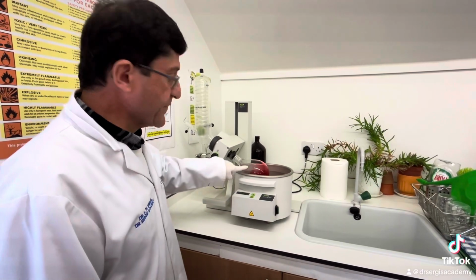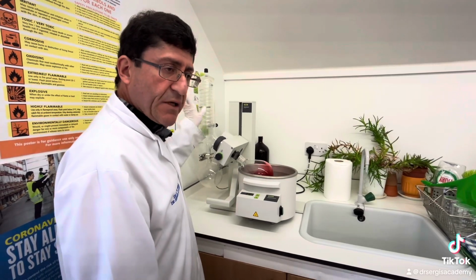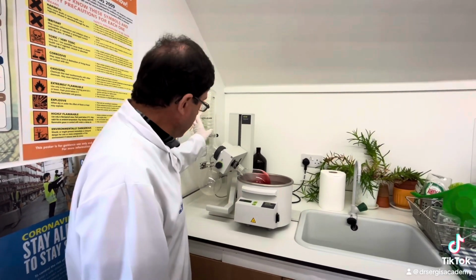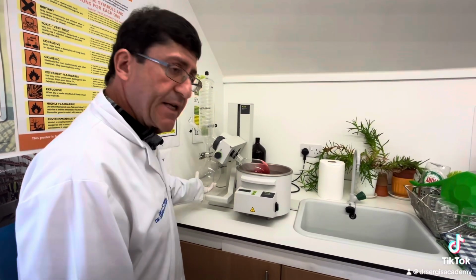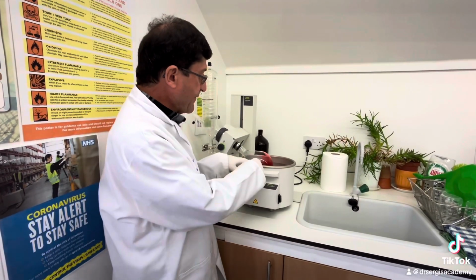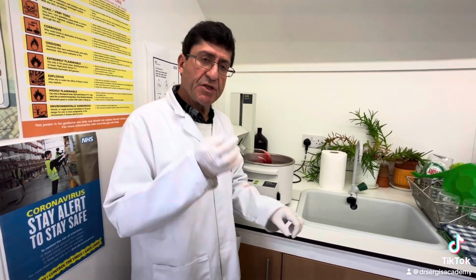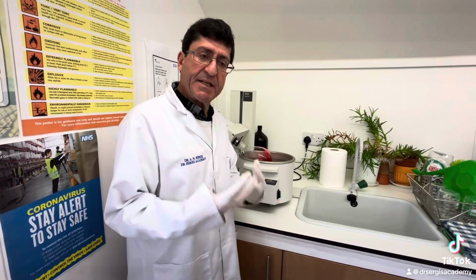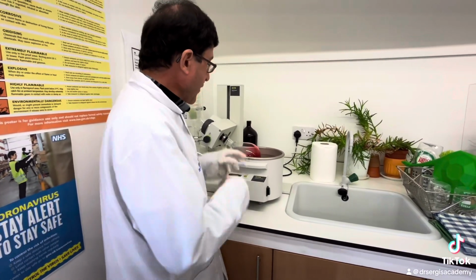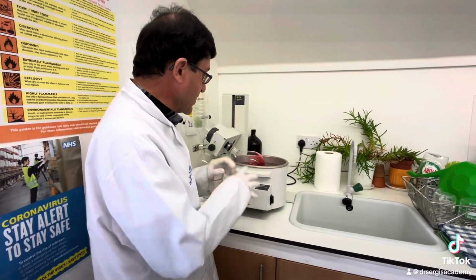So you've got evaporation of the solvent, which turns into a vapor, which is a gas. The vapor then cools because it loses heat to the water or the air, which is cooler than the vapor, and thereby condenses, and because of gravity, it falls as a liquid, which is received in this receiver flask. And then eventually what we have here in the rotary evaporator is, for example, a white crystalline solid, which is your pure chemical. It could be an anti-cancer agent, like when I was doing work on making anti-cancer drugs, or indeed any particular chemical. So that's how we use the rotary evaporator.